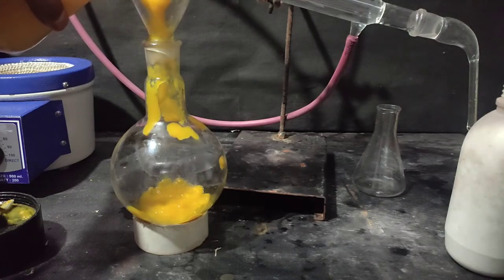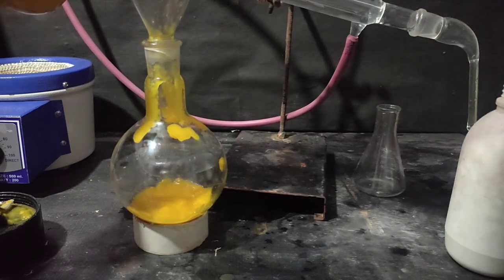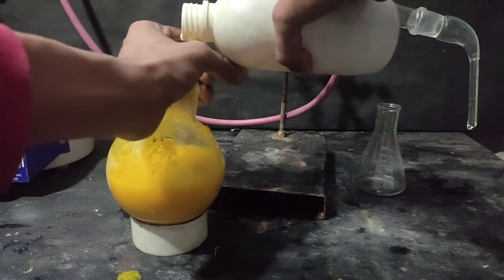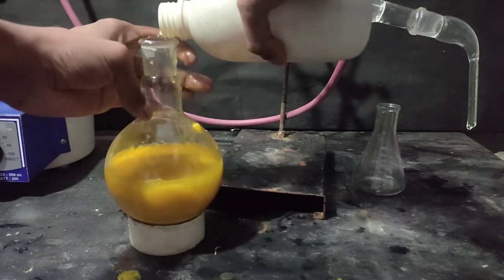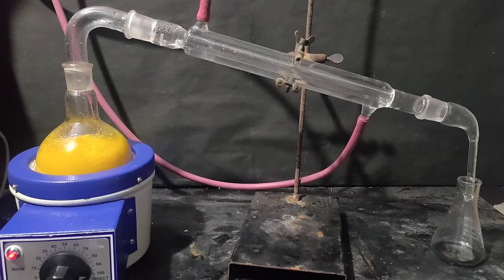Then I added some more water inside the flask and set the apparatus for steam distillation.